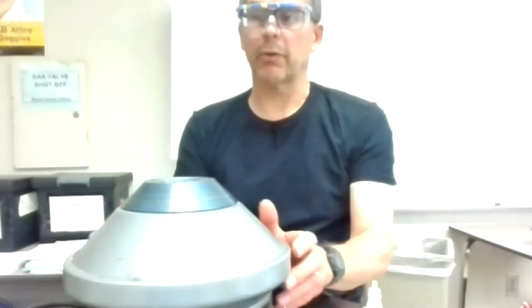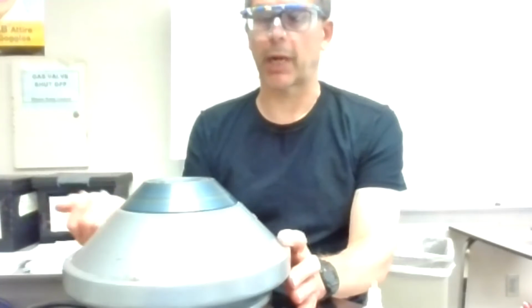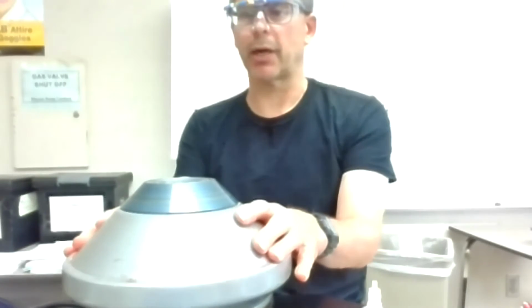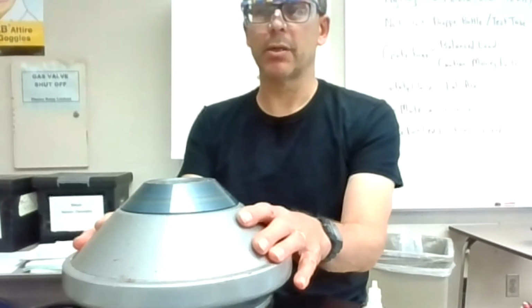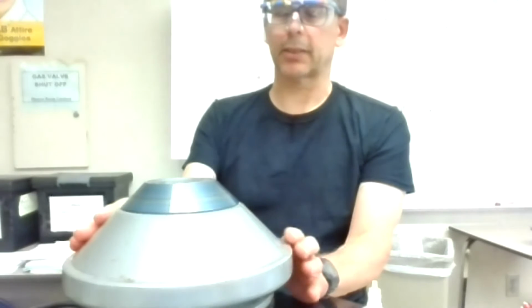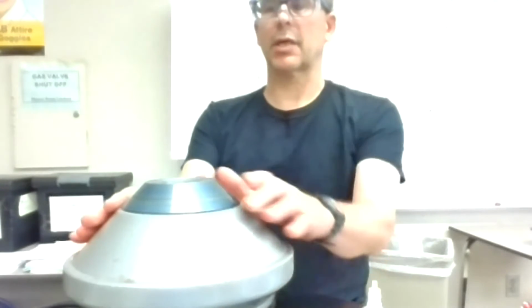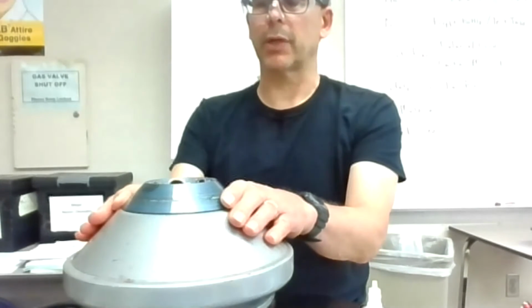Whenever I use the centrifuge, I always put an empty one across it, or actually one with a little distilled water, so it's about the same weight in each test tube. It keeps a better balance and doesn't wear out the rotors on this centrifuge. I'm giving that a good spin. I think that's going to be good. Let's stop it there, slow this down pretty quickly, and go to my test tube here.